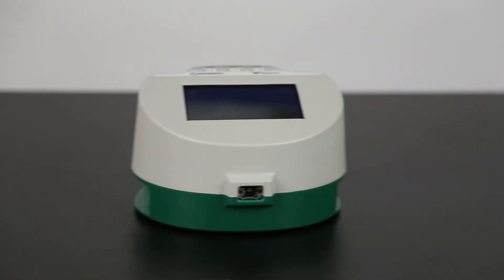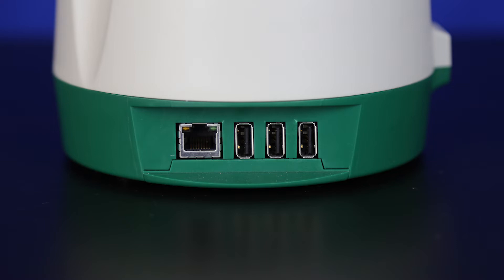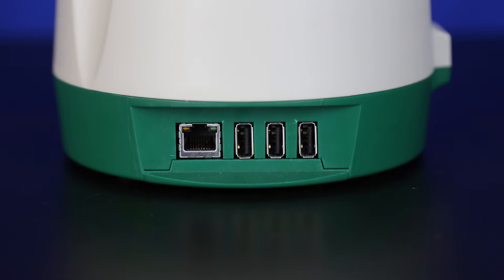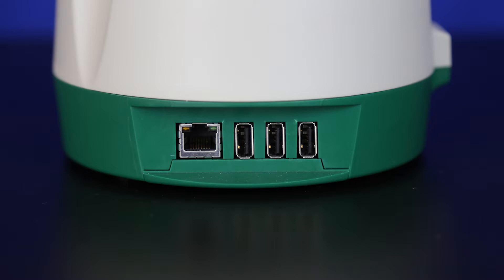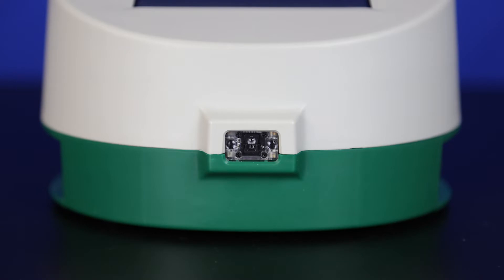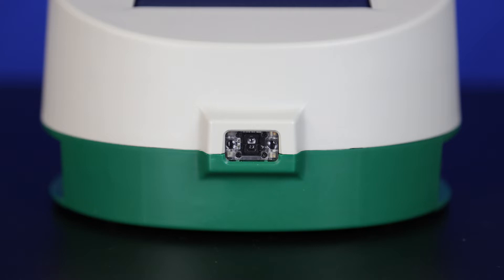The Raptor Integrated Analysis Platform is a lateral flow test strip reader with built-in incubation. The Raptor's left side has three USB ports to connect standalone printers and other USB devices. It also has an Ethernet port to transfer data in real time to a laboratory information management system or other process control systems. On the center front, you'll find an industry-first built-in barcode scanner that serves two functions: scanning lot-specific information like expiry dates and scanning sample IDs.